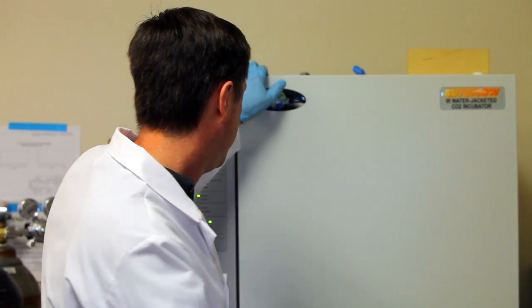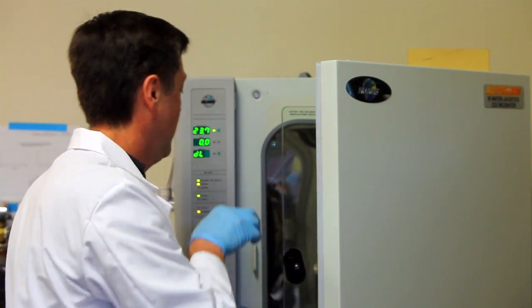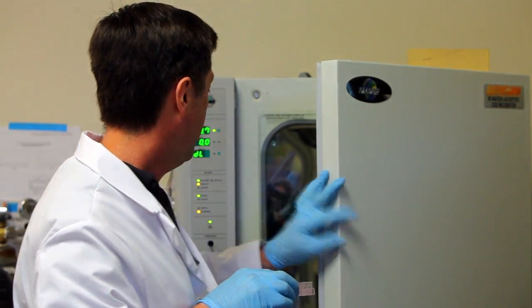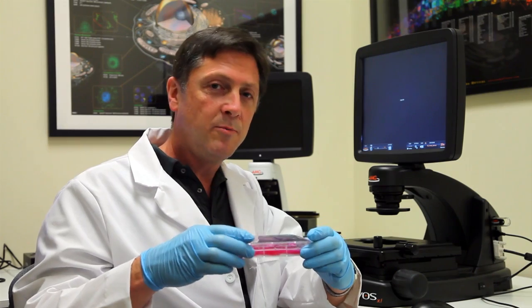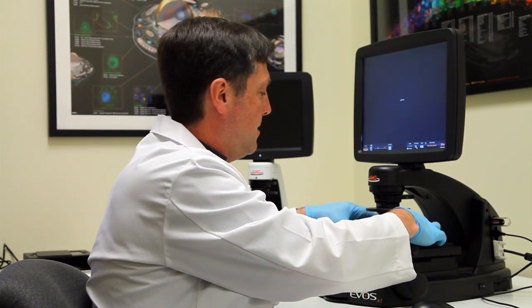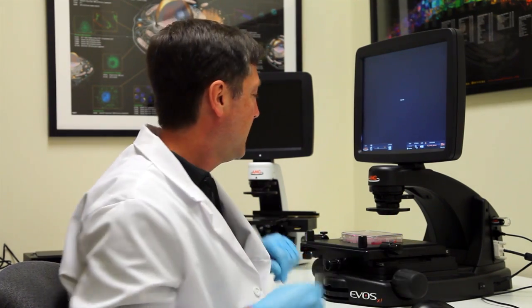I'll just grab our cells and we'll head over to the microscope and do some cell counting. Okay, we have our cells. I'll put them on the microscope and we'll move over to the upper right well there. We're all set to start.